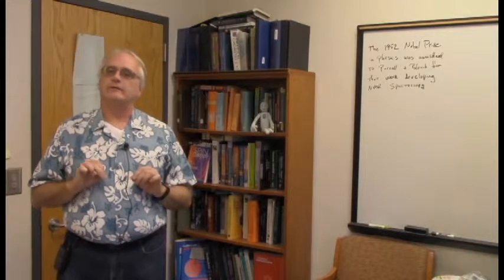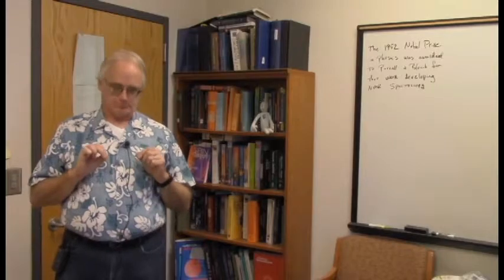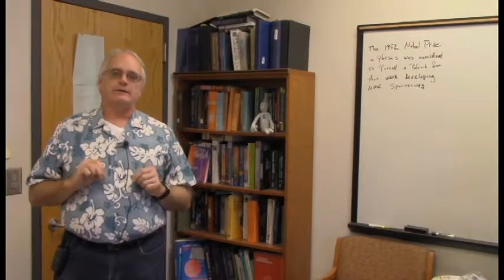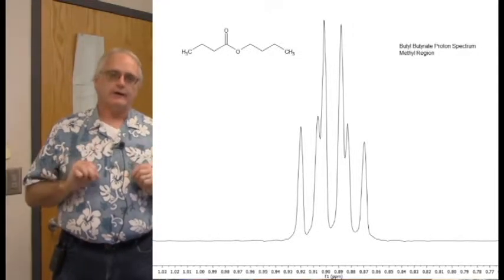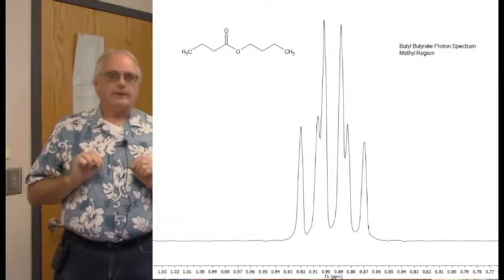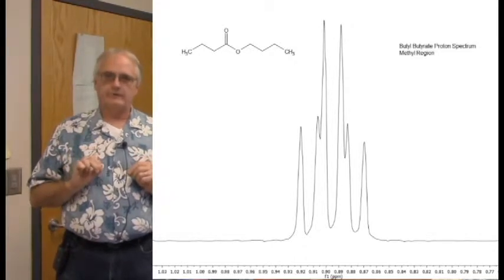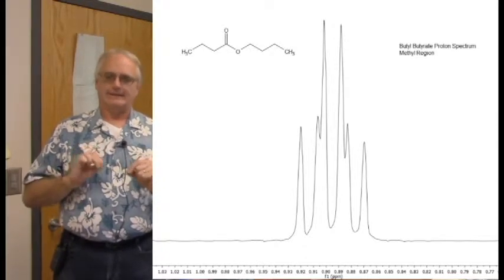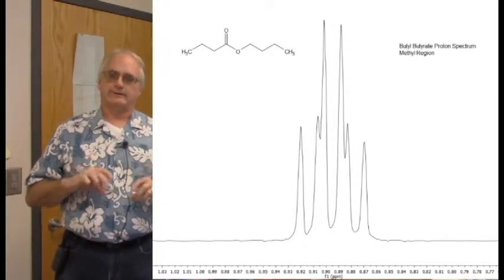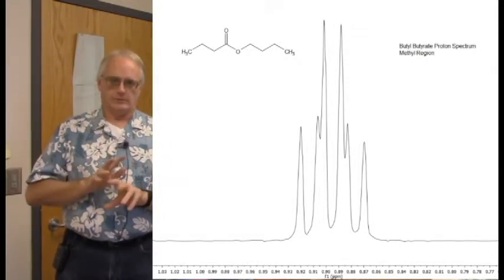For those of you playing along at the home game, you will also notice that the methyl groups of butyl butyrate are actually pretty badly overlapped as well. You see it in the proton spectrum here, where it does integrate to 6. Look at it carefully. In theory, these 2 methyl groups are different, should have different chemical shifts. The molecule is not symmetric, and indeed they do, but they are almost the same. Look at this thing. This is not a classic textbook doublet or triplet. This is 2 triplets almost overlapped on each other.